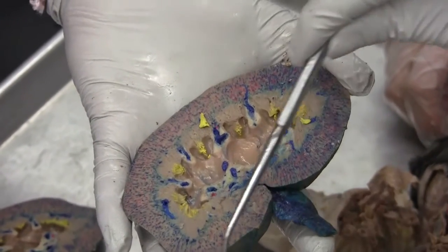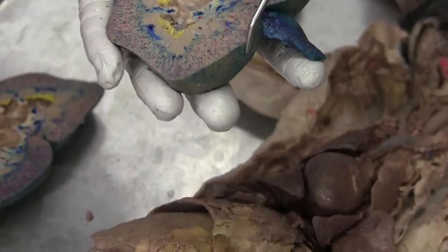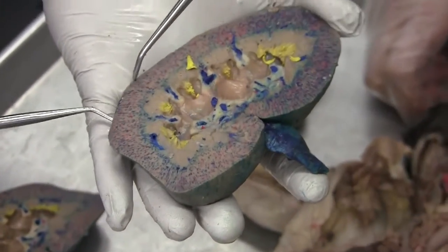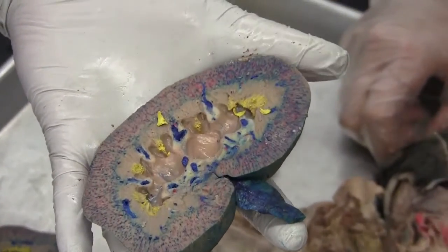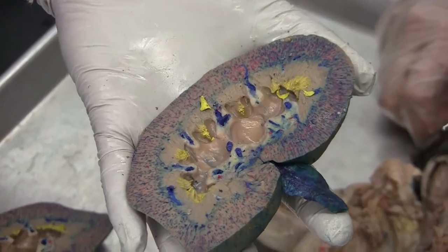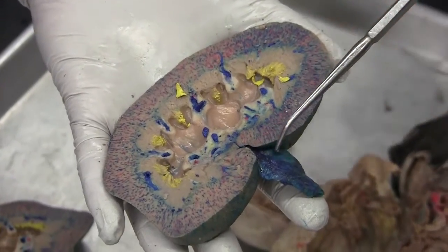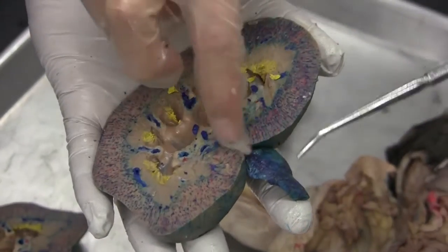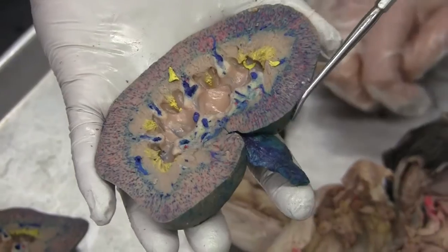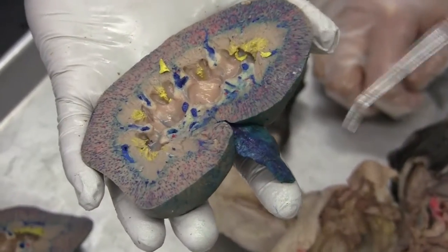The renal capsule. The renal capsule is this outside casing. The renal hilum — is that this? The renal hilum. It's this little dimple here. Indentation.